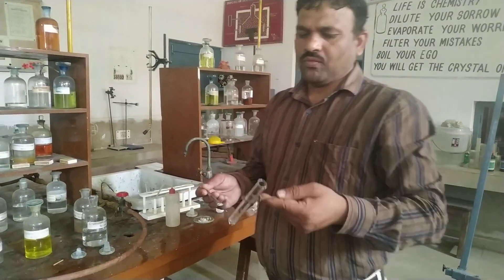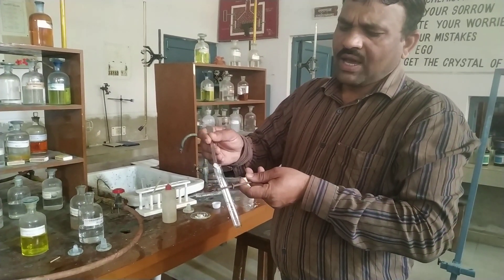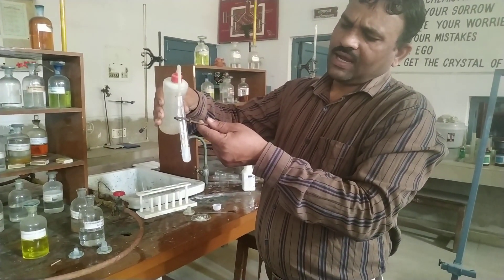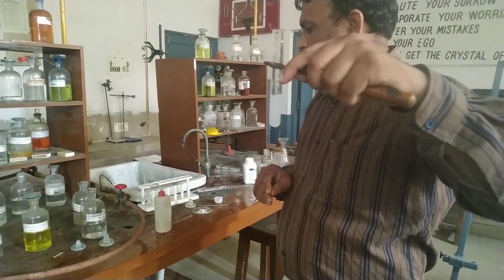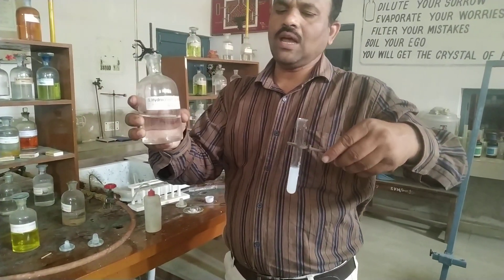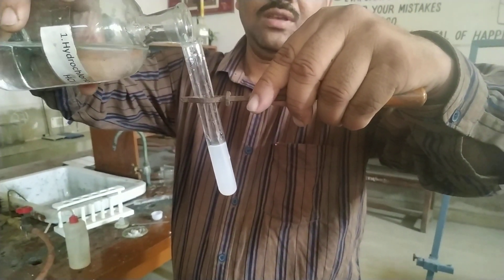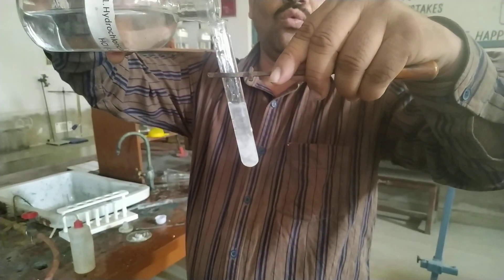In the salt analysis of the first group, we have two radicals: lead Pb2+ and silver ion. We are now confirming the presence of lead. We have taken salt in a test tube and added water to prepare the original solution. To confirm the presence of group 1, we add dilute hydrochloric acid. If it forms a precipitate, that indicates the presence of group 1, meaning lead or silver.